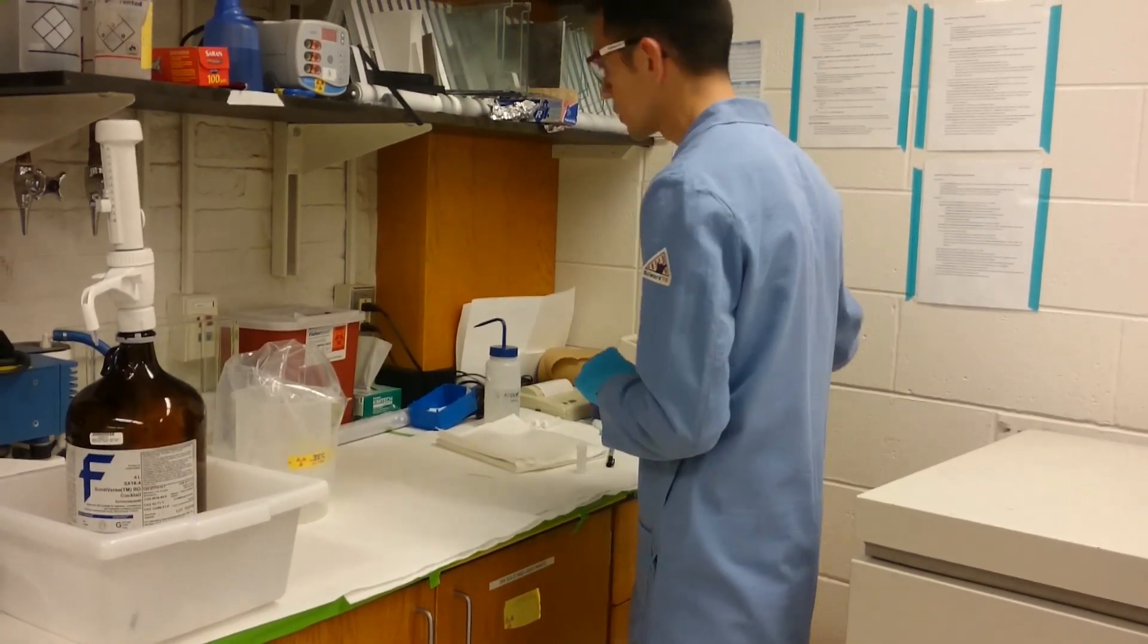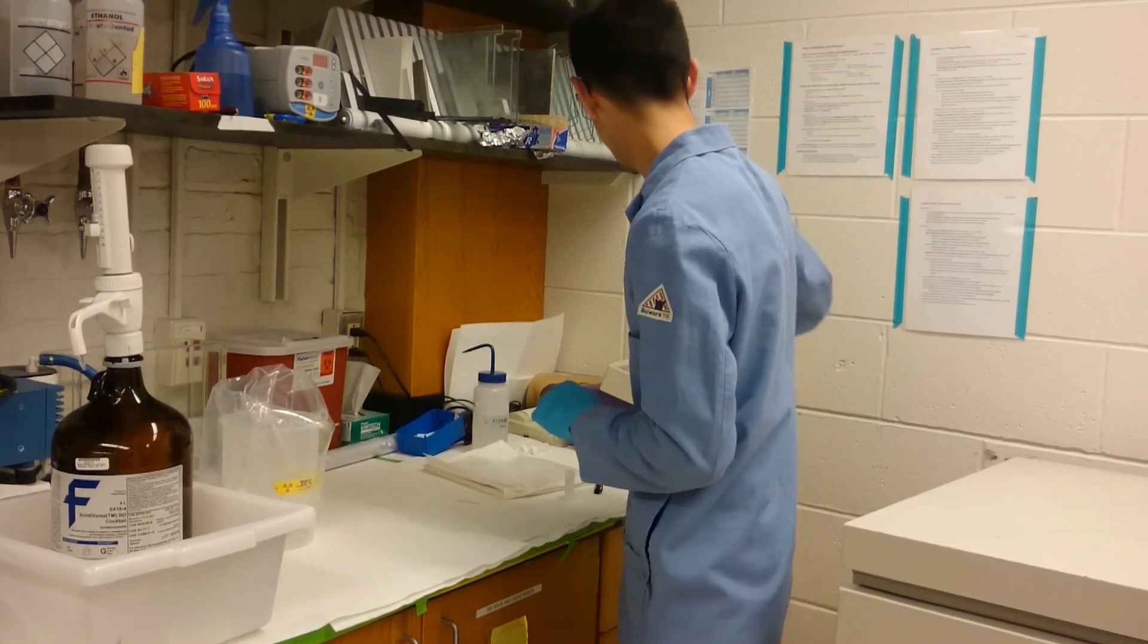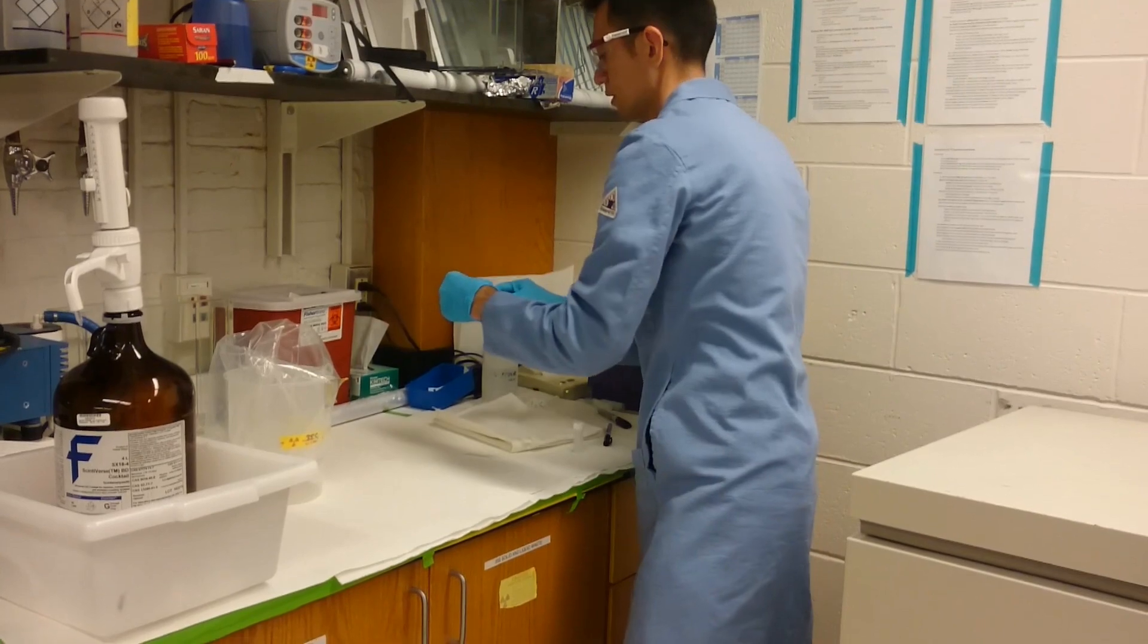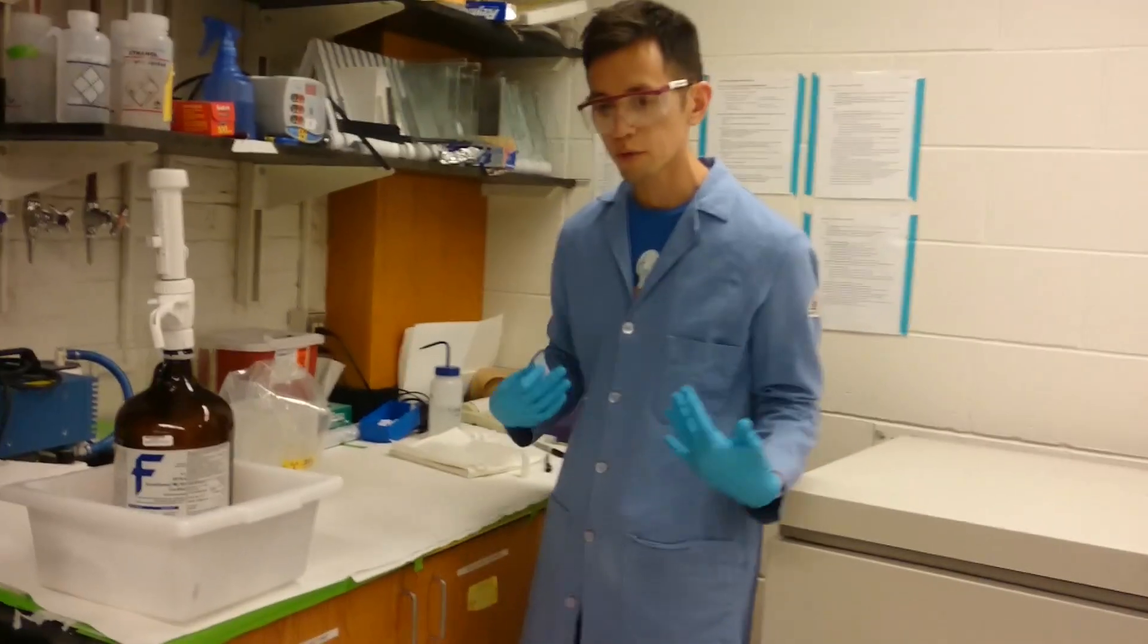So the lab coat is clean. Now I'm going to check the bench.